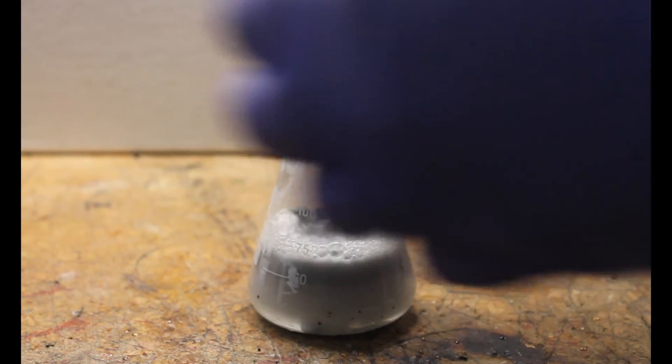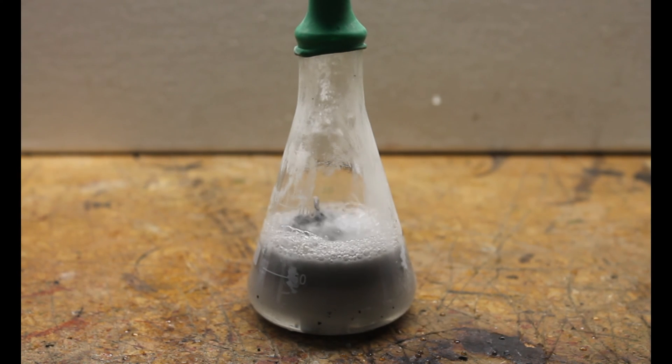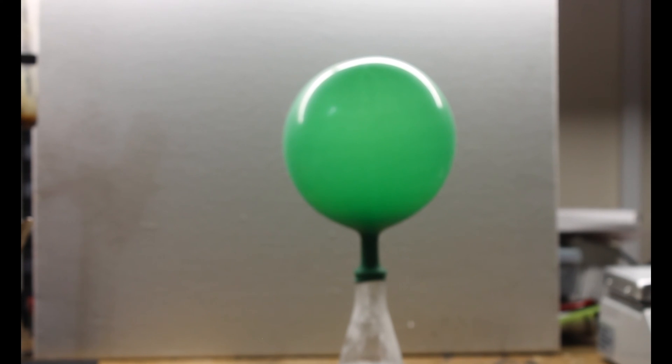Instead I decided to pop a balloon on top to catch the gas that was being generated. The balloon quickly swelled to a particularly large size.